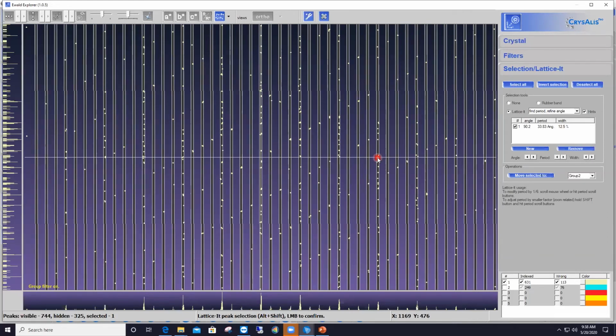So here what I want you to see is that we have indeed our rows of reflections, those that I will say are fully populated with reflections, properly selected within those bars. However, the next fully populated bar or row of reflections is all the way here, okay? That one. And in between, we have, at the moment, 3 intermediate rows. But you see that these 3 intermediate rows contain very few reflections. It's just that in this orientation, those few reflections happen to be aligned as well.